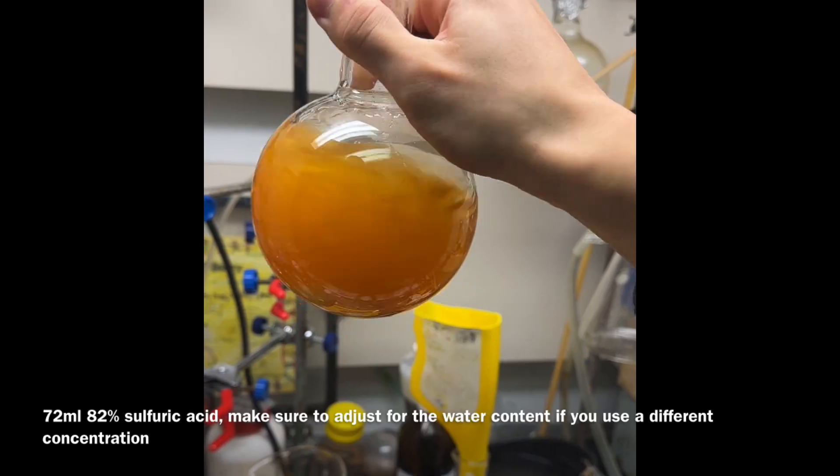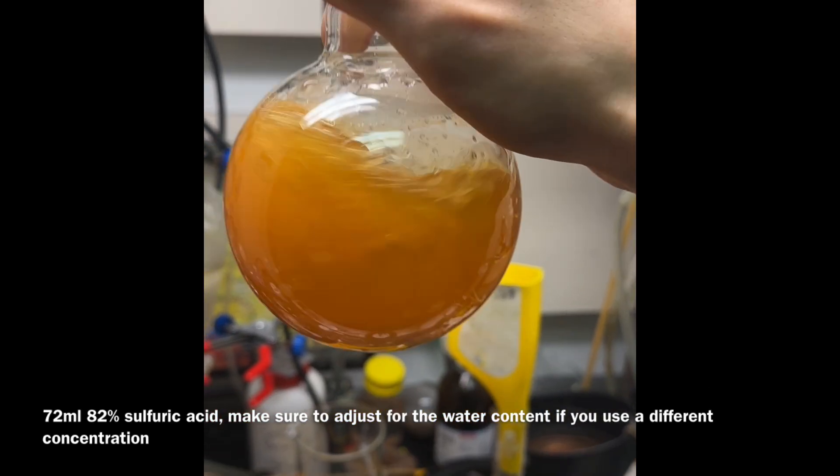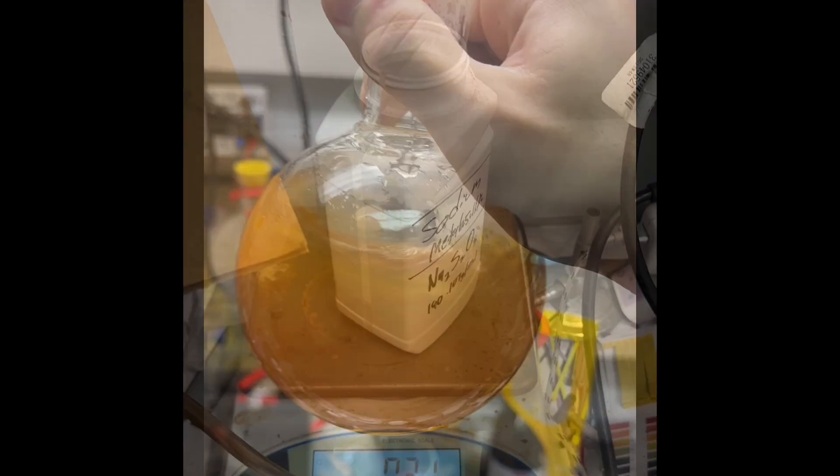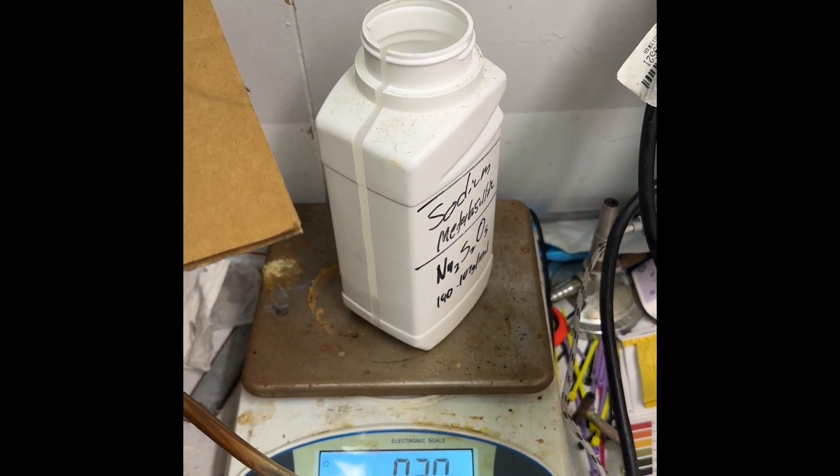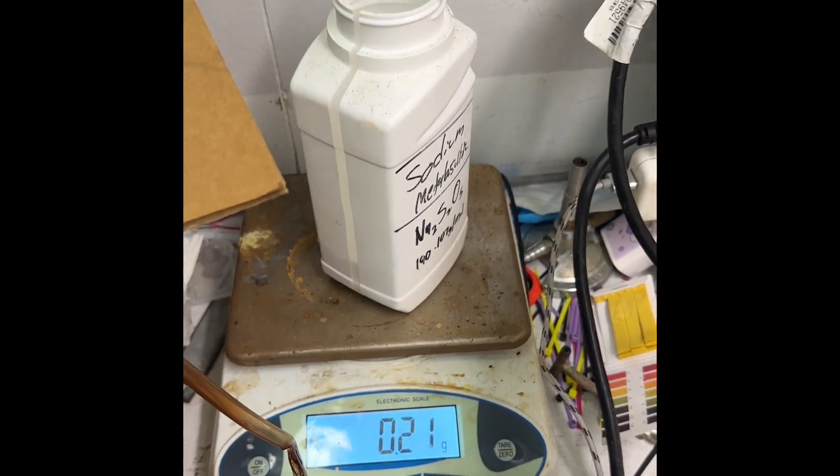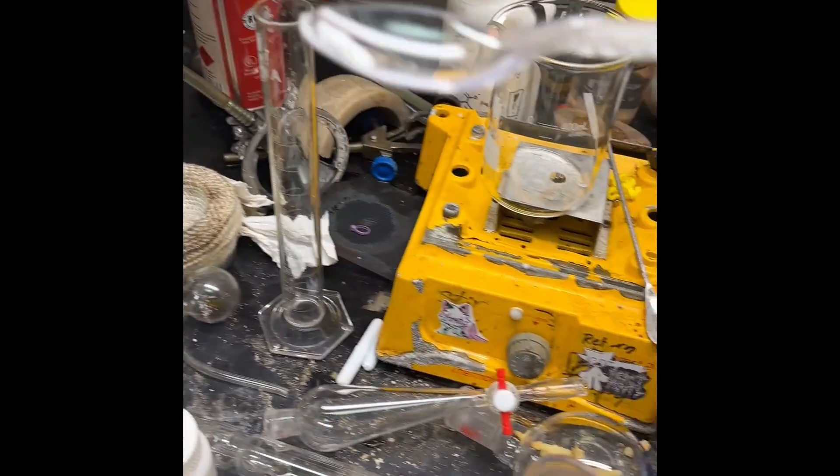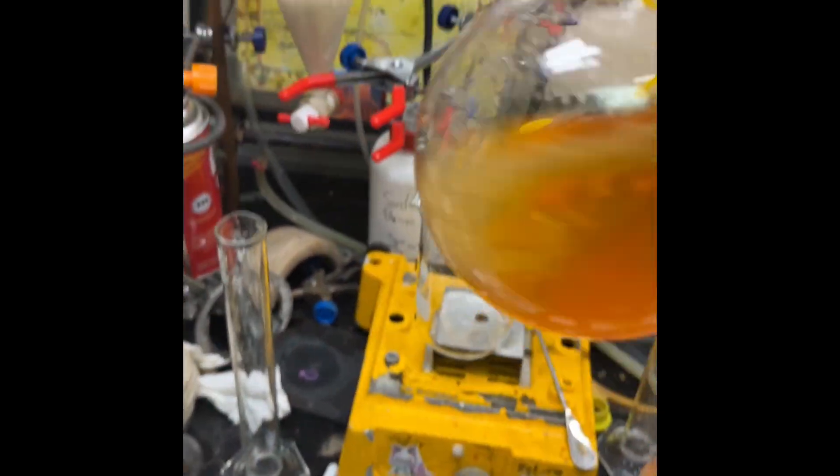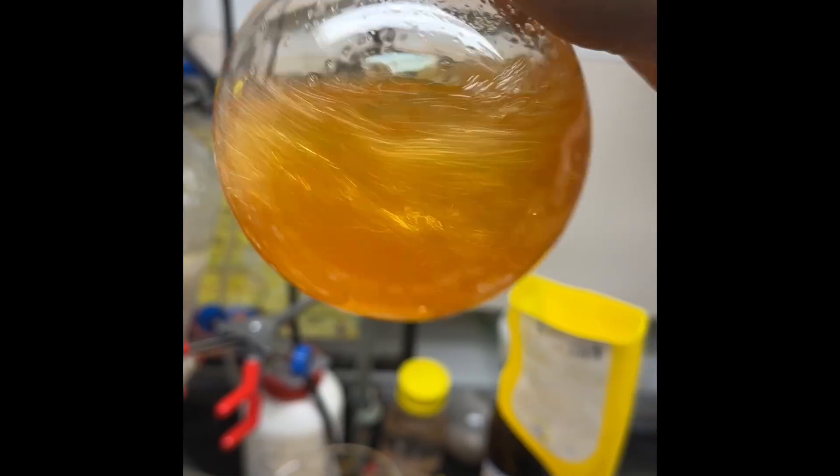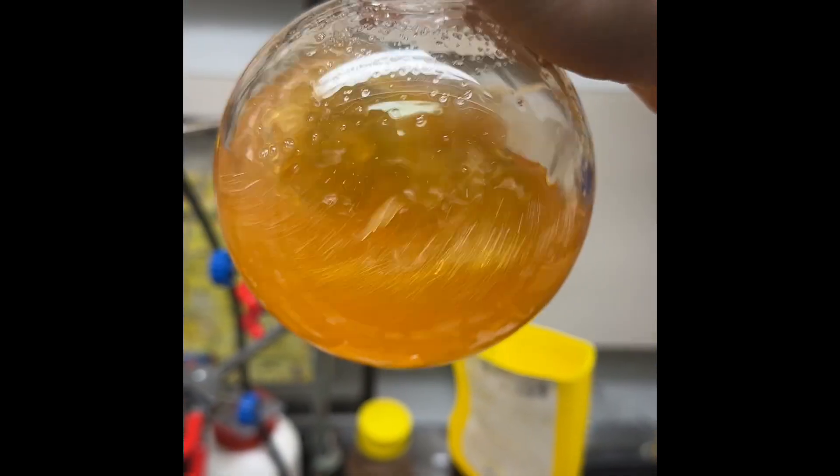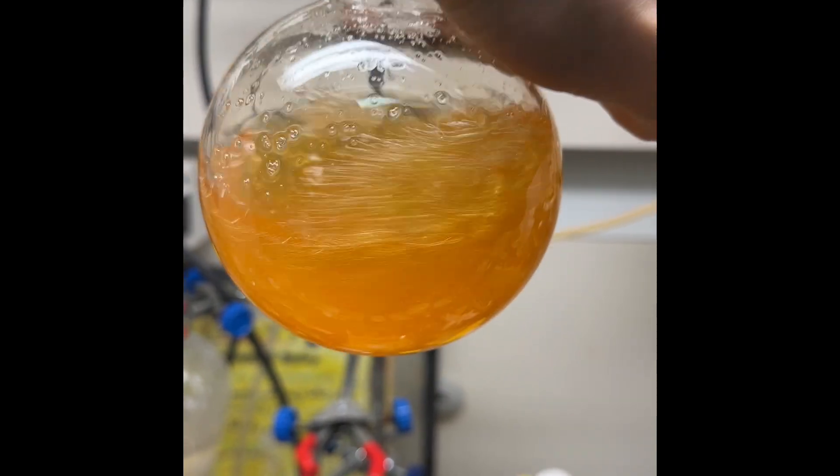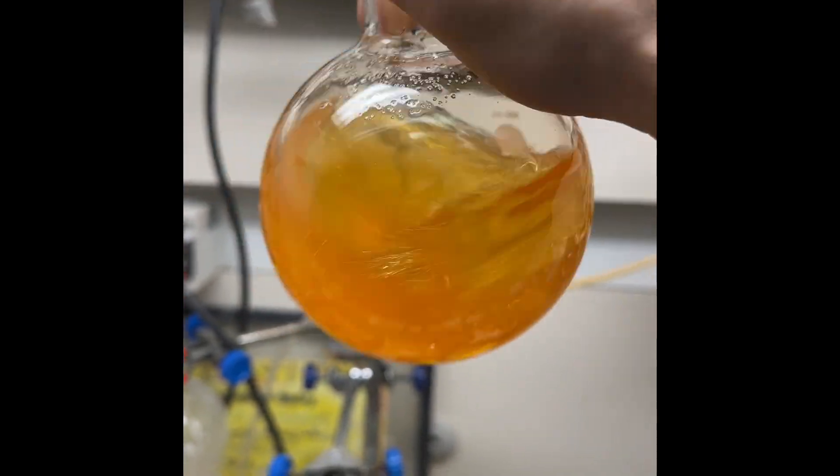There is a slight smell of bromine for sure. The heat will hopefully dissolve this in, and then I'll show you a very simple trick to discharge the bromine. The magic ingredient is sodium bisulfite, a reducing agent. I've got about 0.2 grams. I'll add this in and you'll see it reacts, it forms sulfur dioxide.